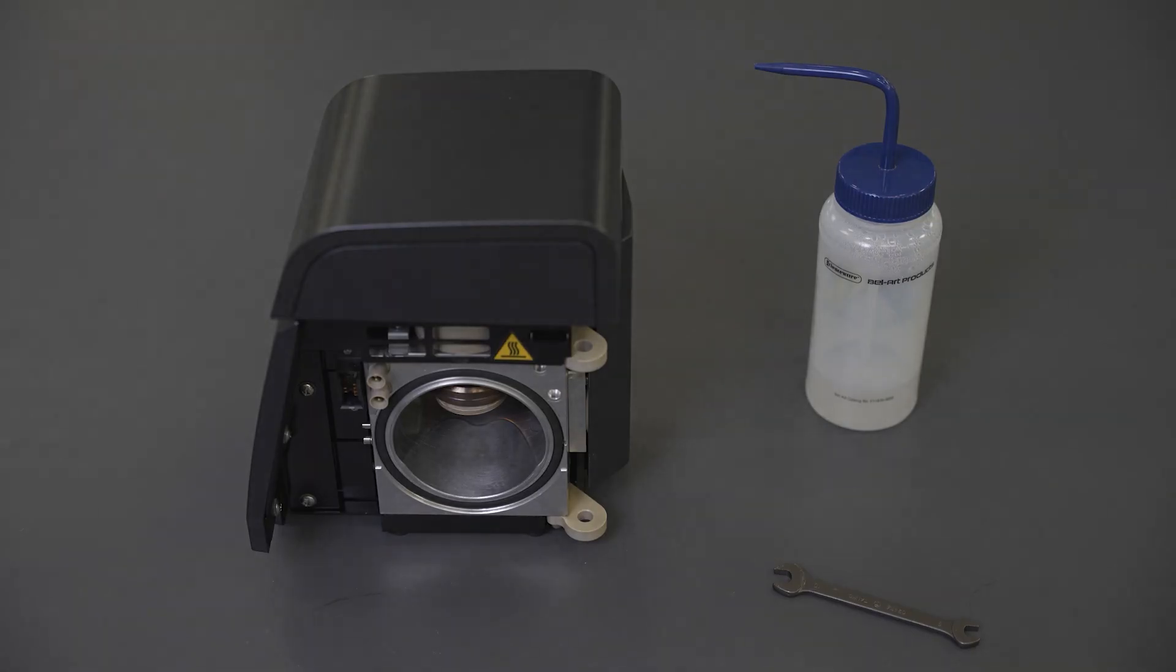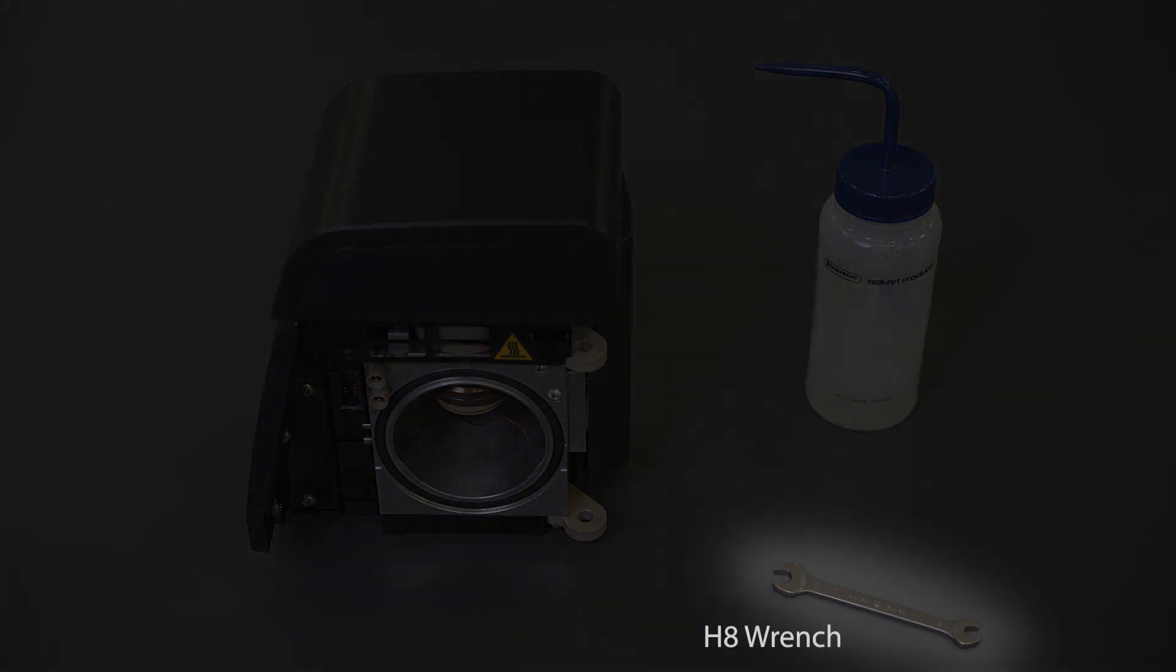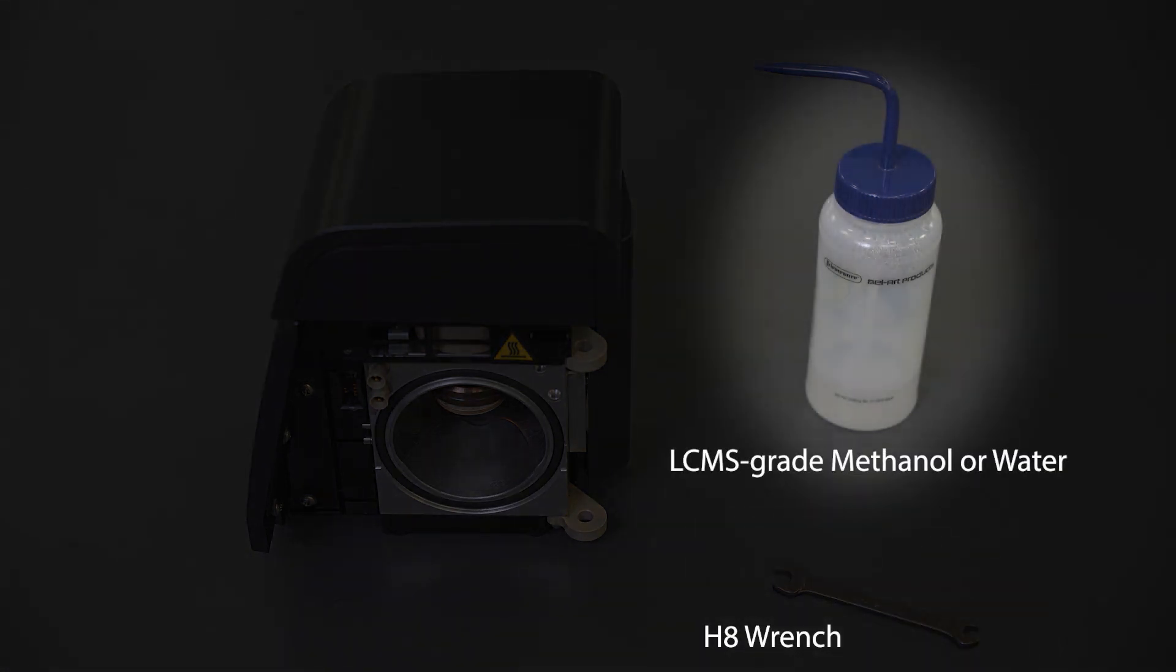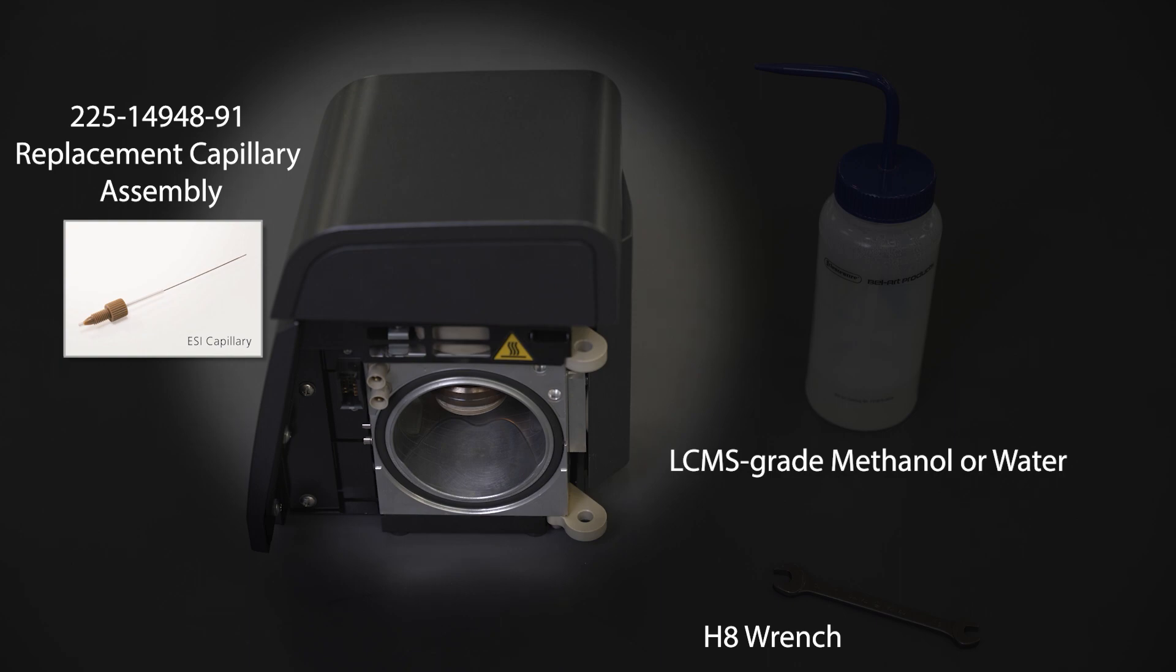You will need the following tools and supplies: an H8 wrench, LCMS grade methanol or water, and a replacement capillary assembly.